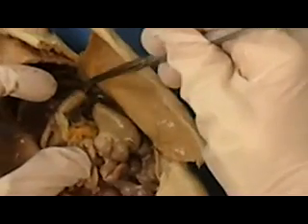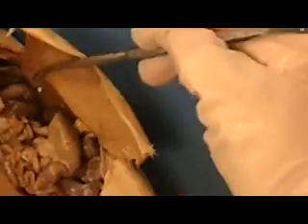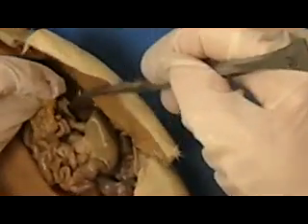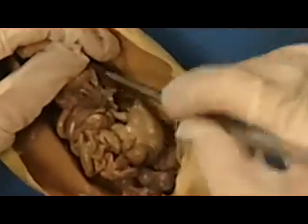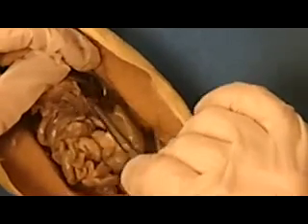Right up under the liver you'll see this structure, which is the stomach, and then under the stomach you will find the spleen. Now if you lift the stomach, the liver, and the spleen up and kind of pull some of this fat out of the way, you'll see this grainy looking material. It goes all the way from the bottom of the spleen all the way across to the small intestine, and that is called the pancreas. So all of that right in here is the pancreas.